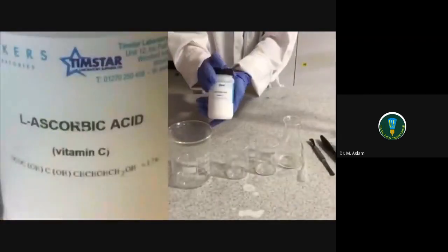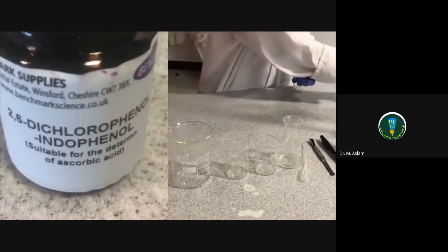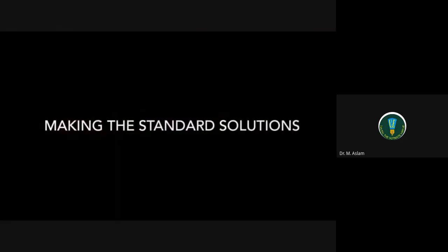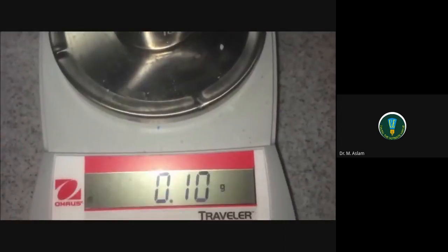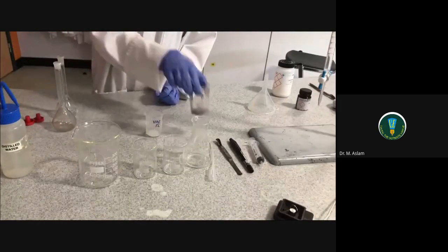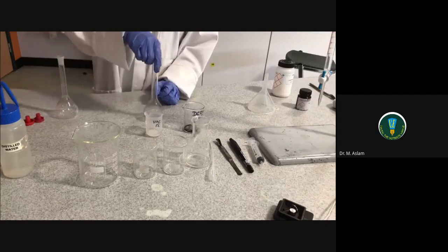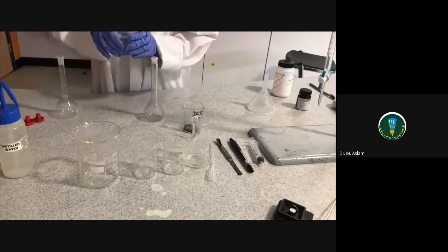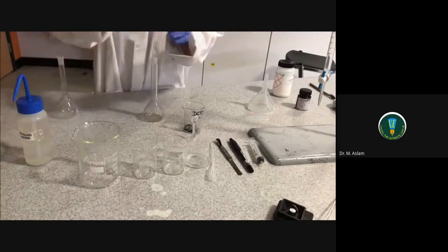The chemicals needed are 1% L-ascorbic acid and 0.1% DC-PIP. Weigh out 1 gram of L-ascorbic acid and 0.1 grams of DC-PIP. Add 100ml of distilled water to the 1 gram of L-ascorbic acid.